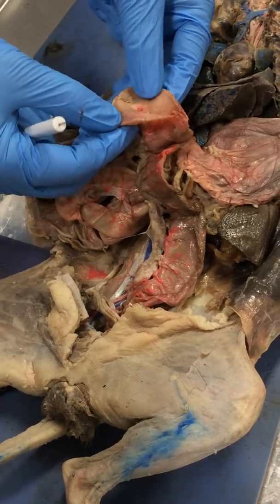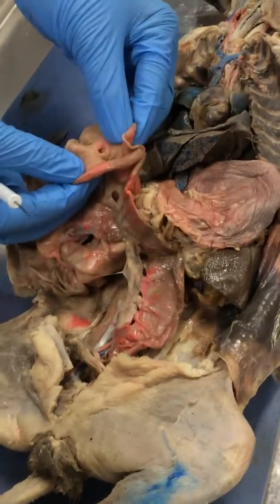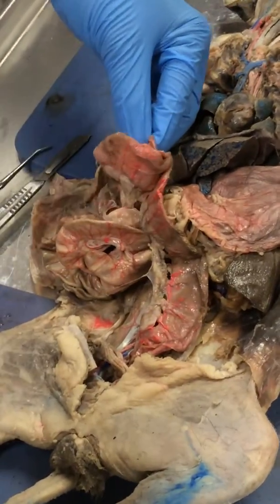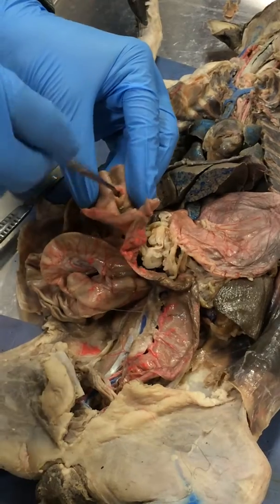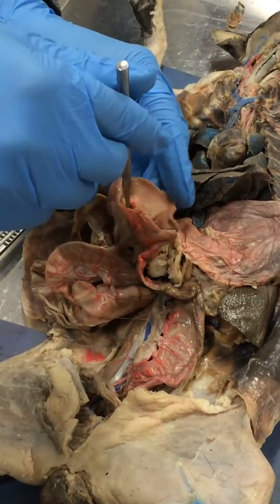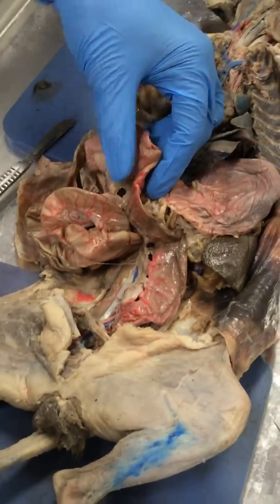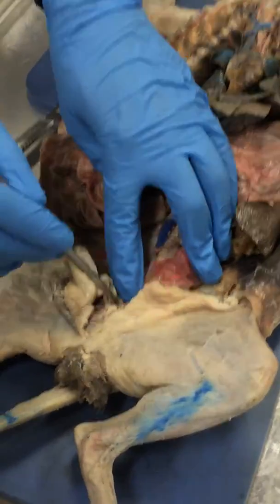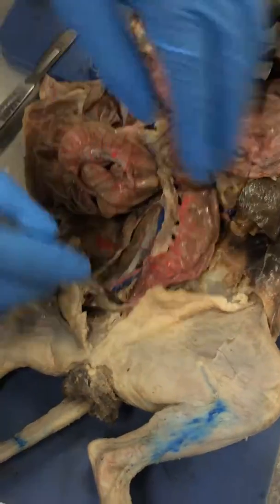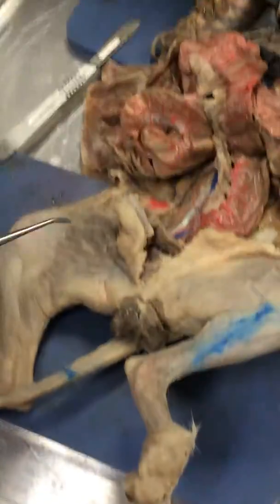The cecum is also part of the colon. This is a specialized name for the area of the colon. And inside here, you can see the ileocecal valve or ileocecal sphincter, or the ileocolic valve, same thing. Then you have the colon, and you have the rectum right here, and the anus and the anal sphincter.